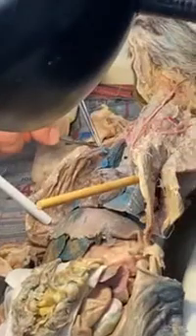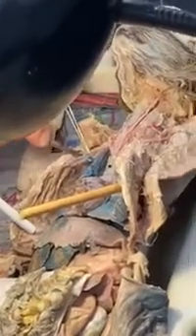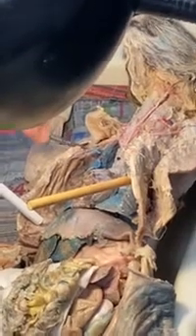And where's the S? There it is. And it's disappearing into the back. It's headed for that. I can feel it with my probe here, the bone that's in there. And that's the subscapular. So that's your IVCT.